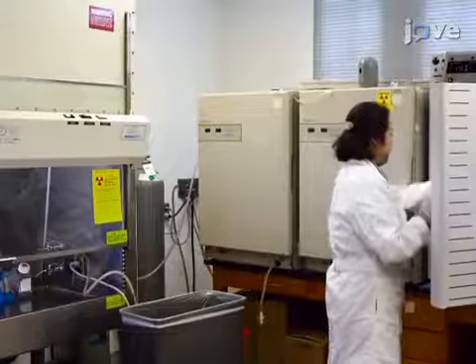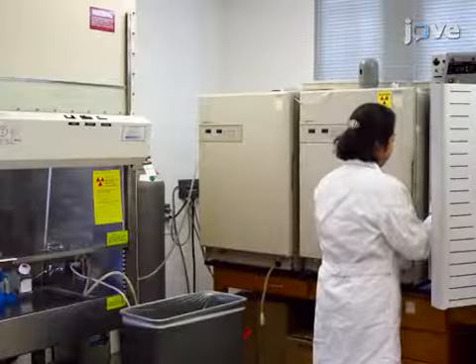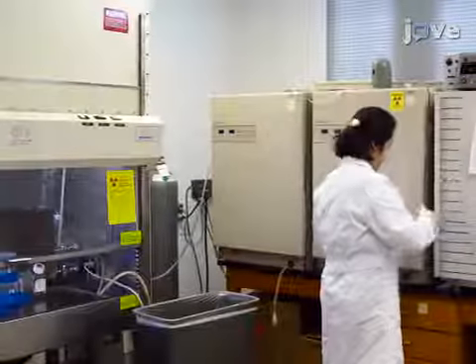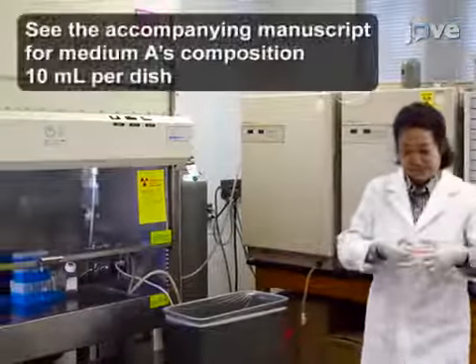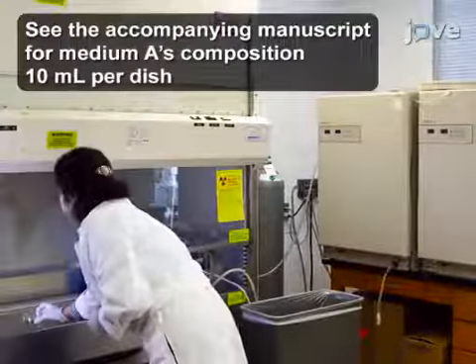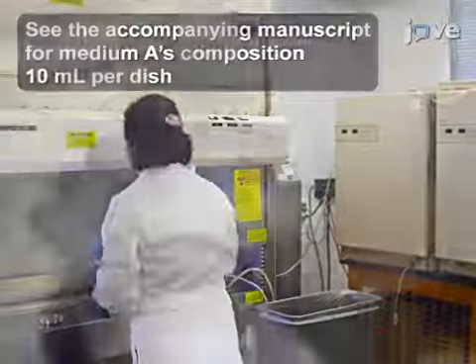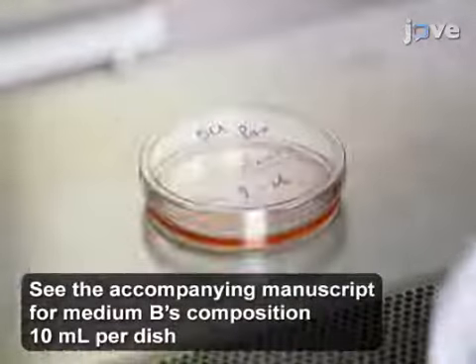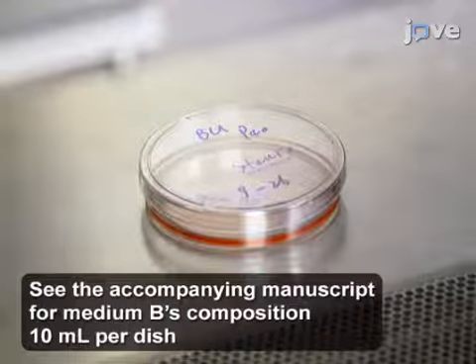To begin this procedure, after passaging the BU-MPT cells onto 100 mm vacuum gas plasma-treated tissue culture dishes, grow them in culture medium A to confluence in a humidified 5% carbon dioxide atmosphere at 37 degrees Celsius. After that, rinse the adherent cell monolayer 3 times with culture medium B.